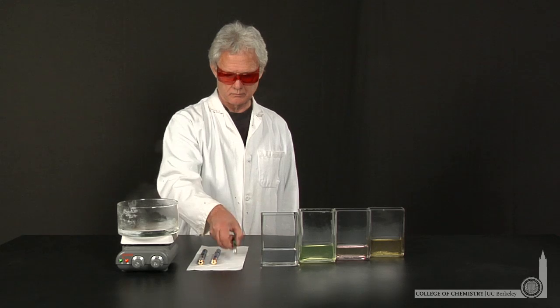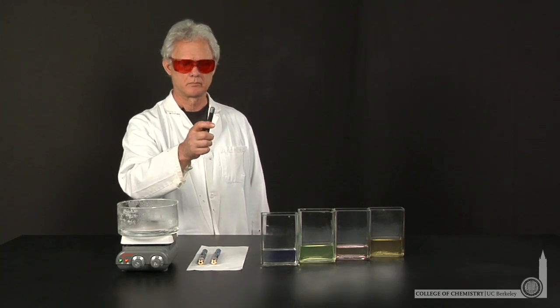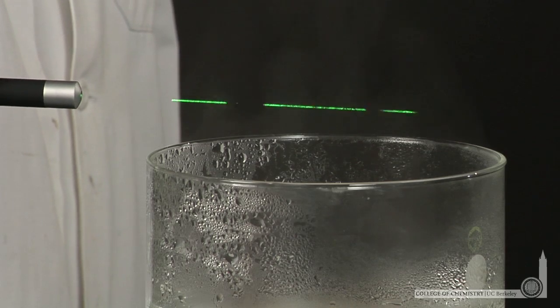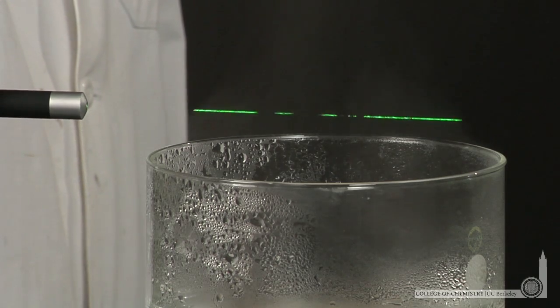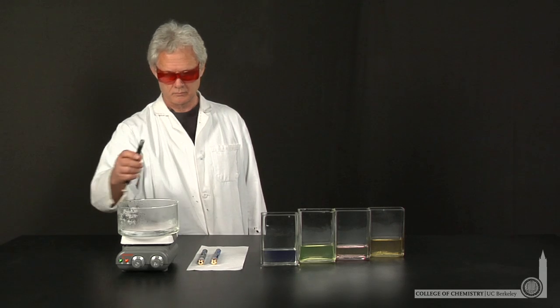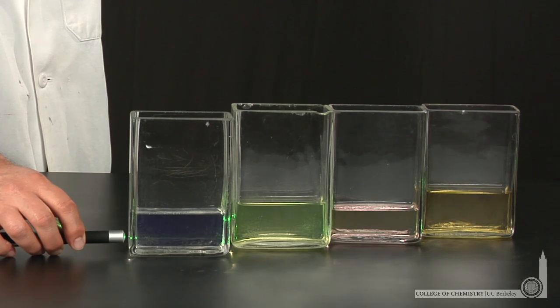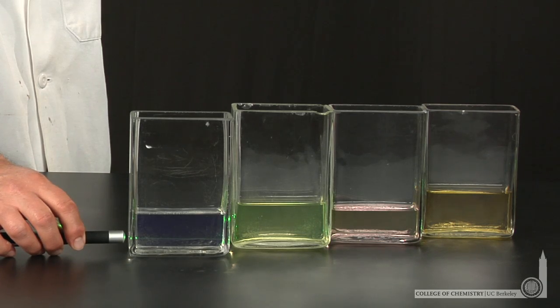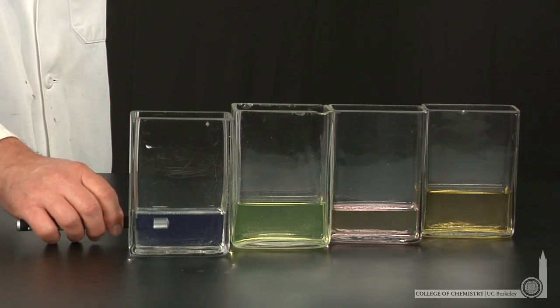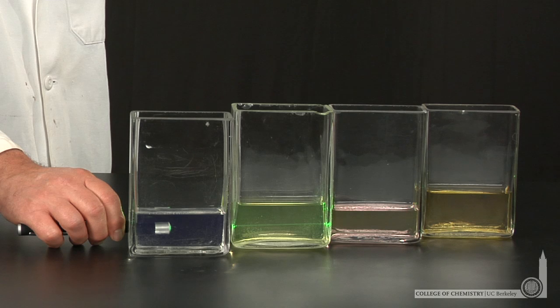One final laser — a green laser — so even lower in energy than ultraviolet and blue photons. The green laser is insufficient to stimulate emission in the blue solution. And the green laser is transmitted through the green solution.